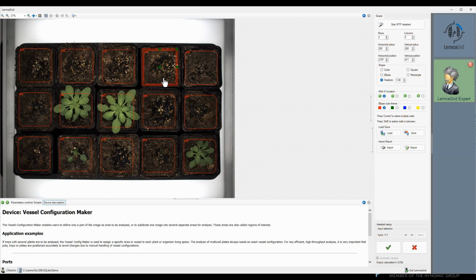These regions of interest are named starting from A01 to C05 in our case. Names always start at 01 in one of the corners. You can select at which corner you start here. Depending on context, this region of interest might also be called wells or positions. So we have created a set of regions of interest, each covering one plant.